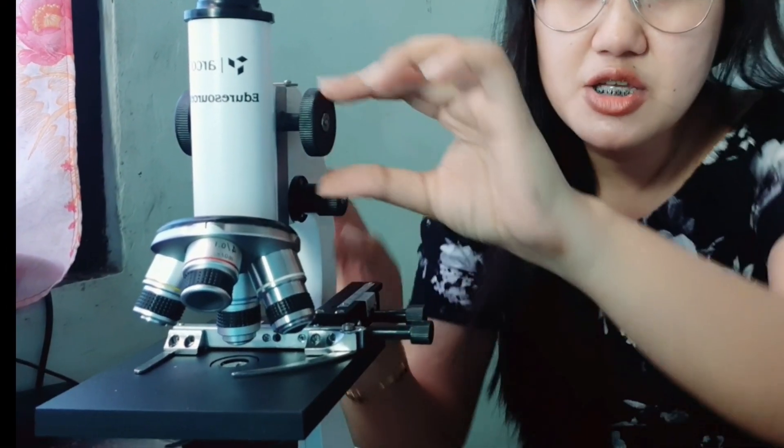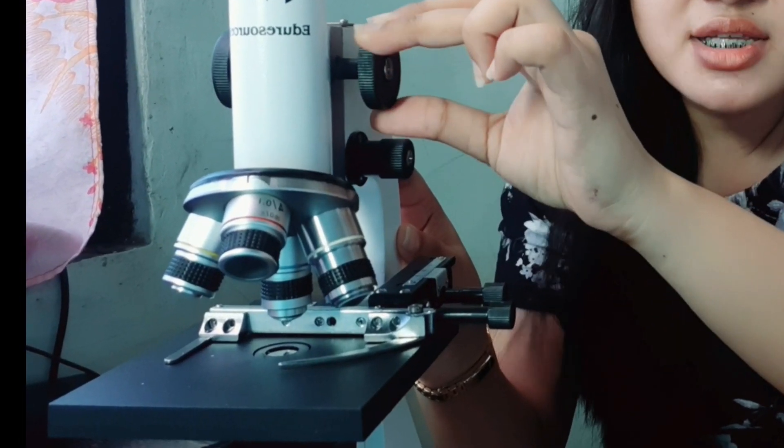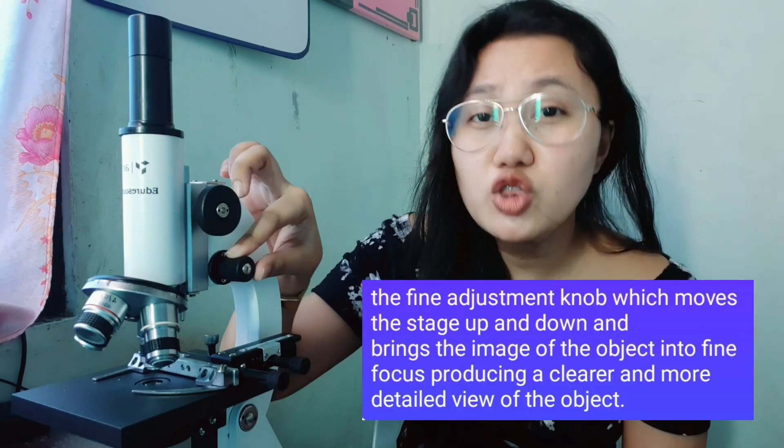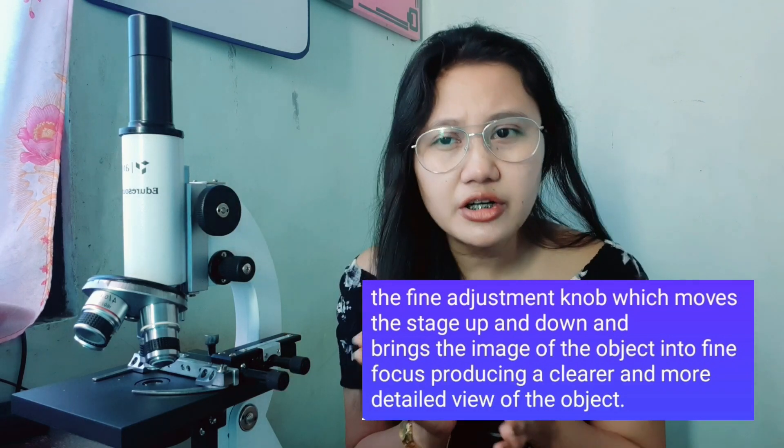The fine adjustment knob also moves the stage up and down, but it is used for focusing. Just like when a picture is blurry and you click to bring it into focus — the fine adjustment knob does this for the microscope. It brings the stage up and down and brings the image of the object into focus, producing a clearer and more detailed view of the specimen.